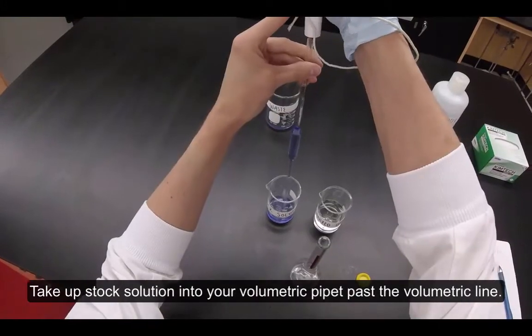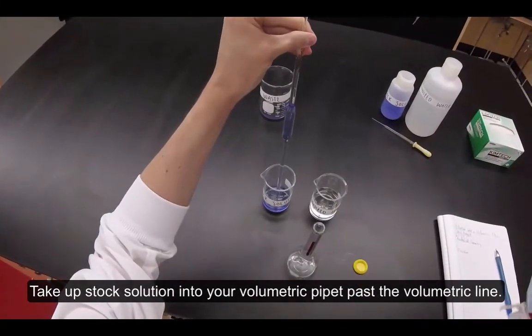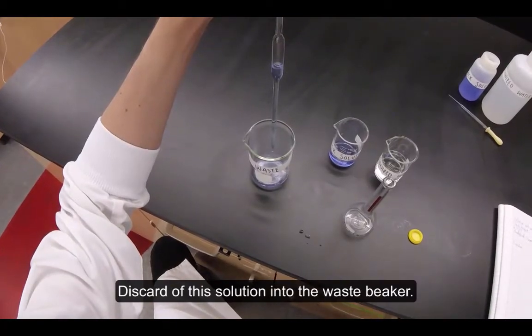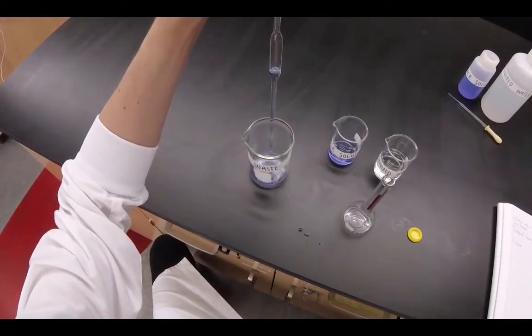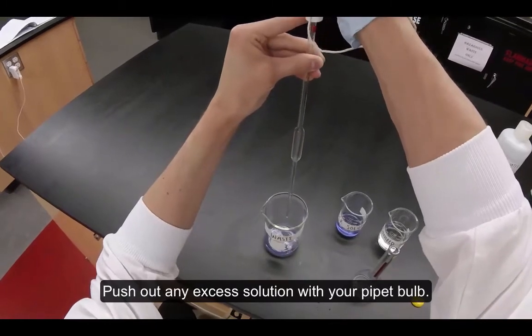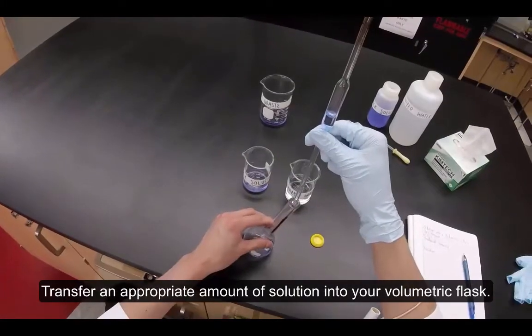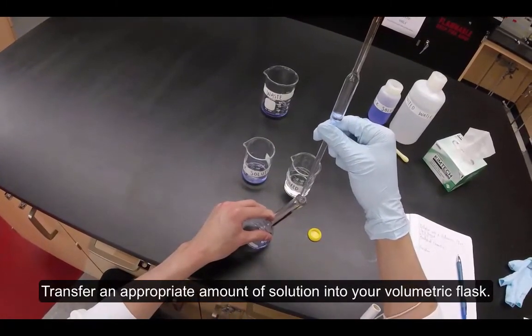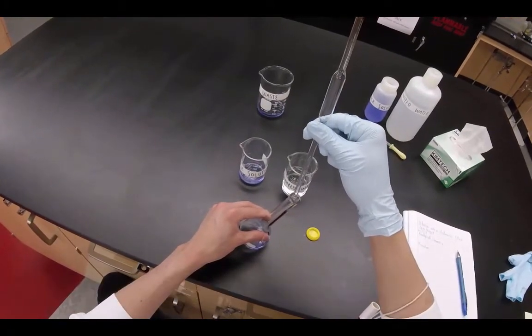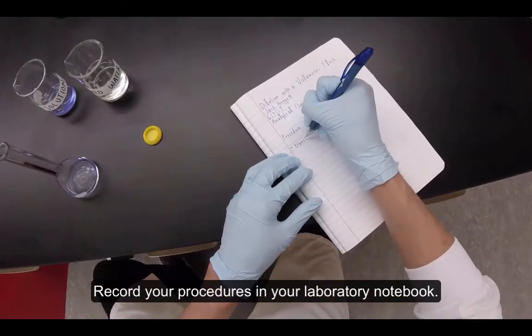Take up stock solution into your volumetric pipette past the volumetric line. Discard this solution into the waste beaker. Push out any excess solution with your pipette bulb. Transfer an appropriate amount of solution into your volumetric flask. Record your procedures in your laboratory notebook.